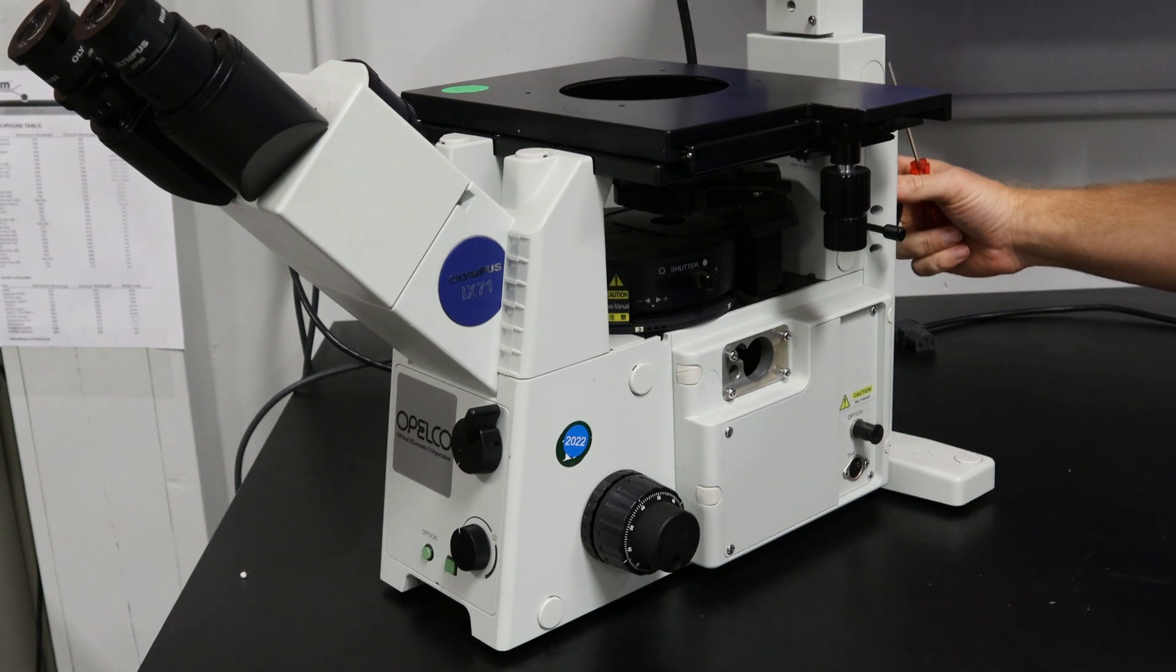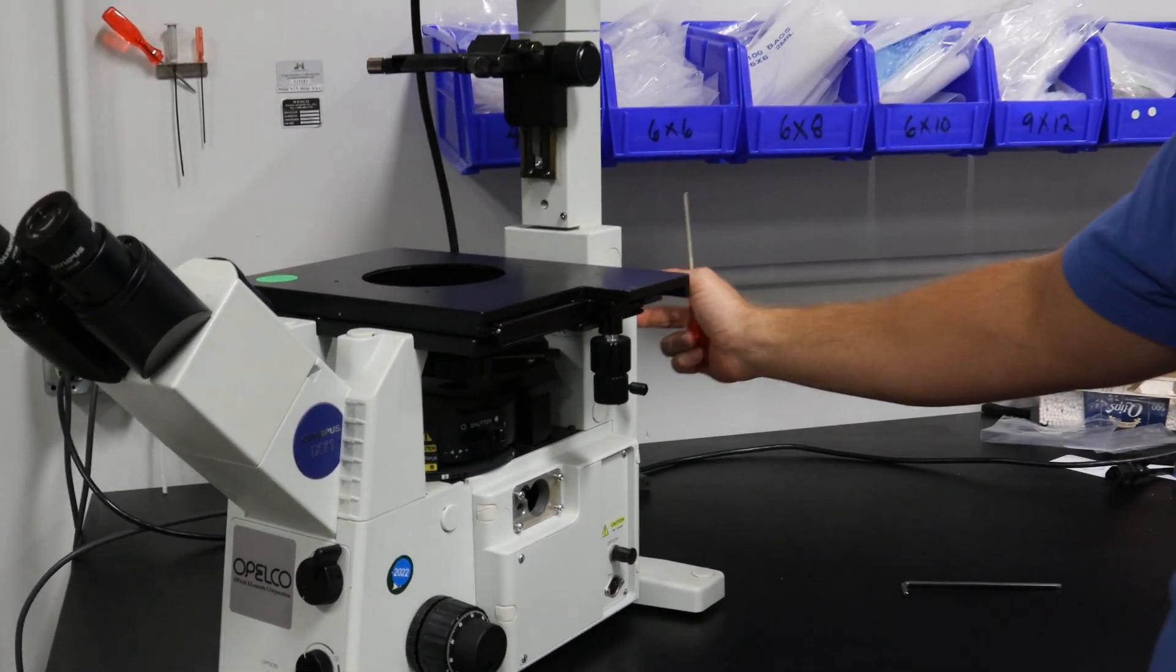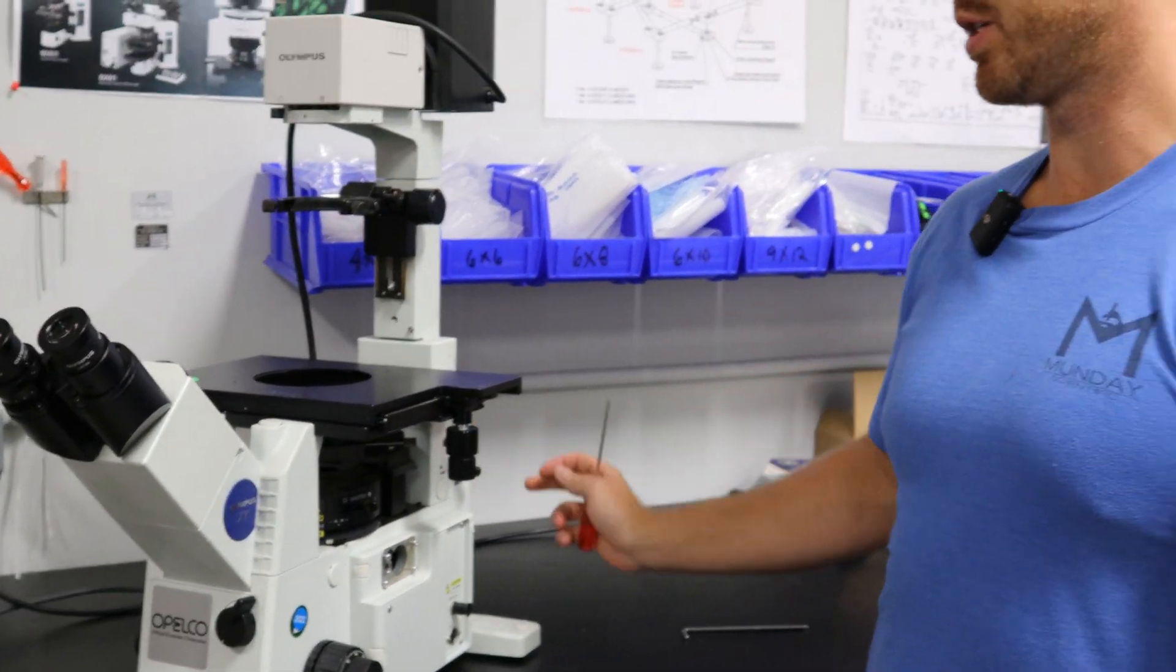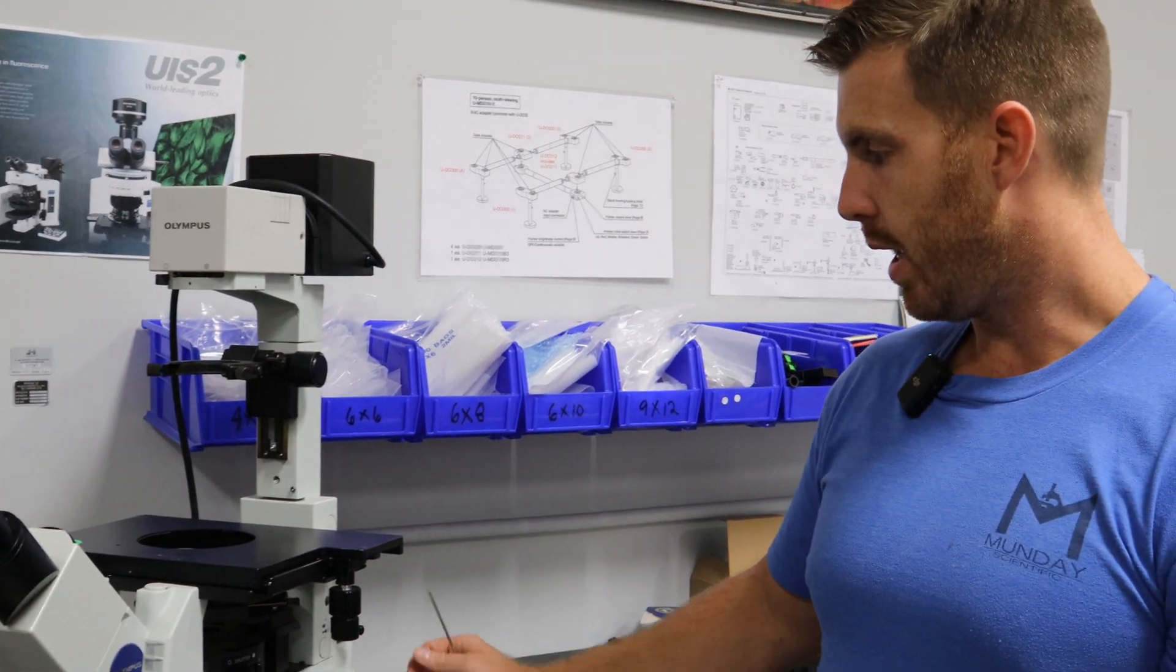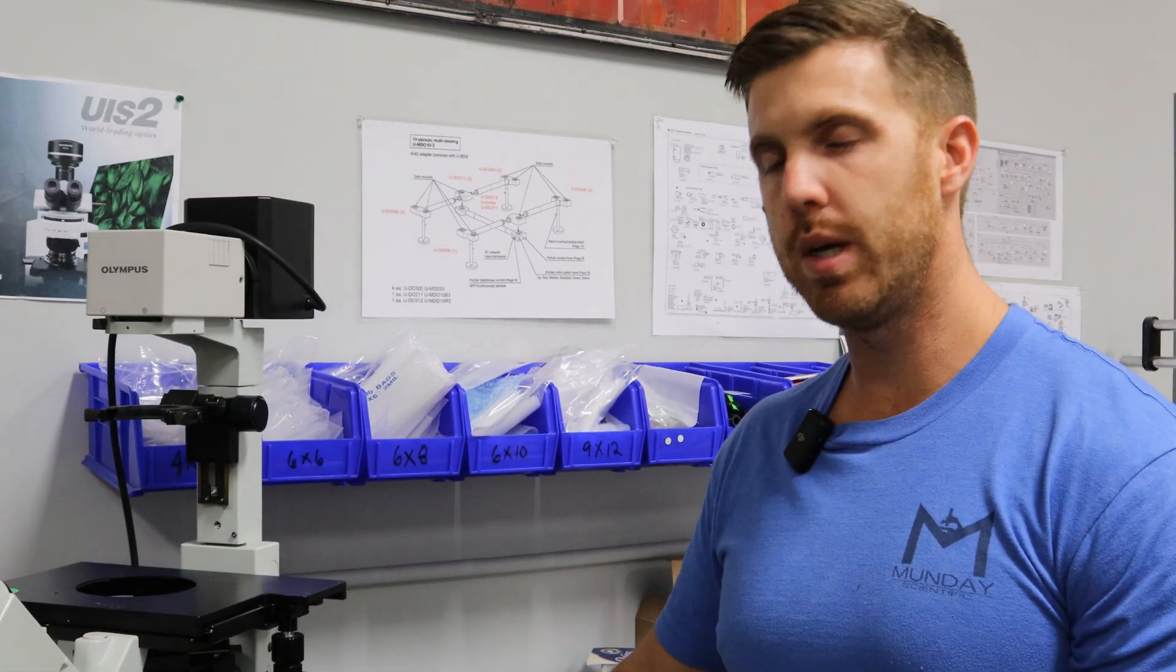Now, once you do this, you want to take the fluorescent power supply, put it on and make sure everything is good and bright. Then your system should be ready to use. Give us a call if you have any questions.